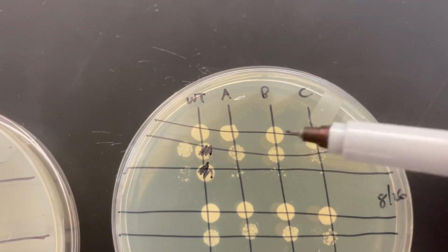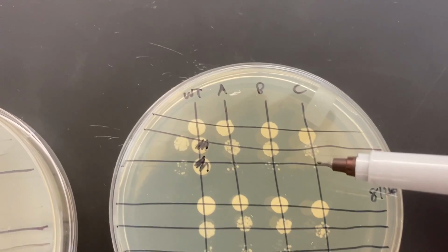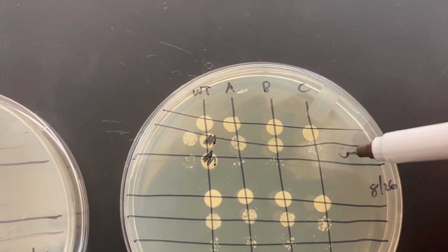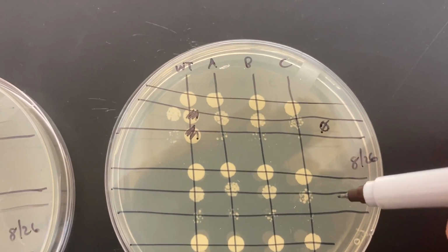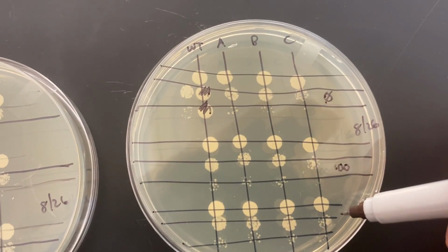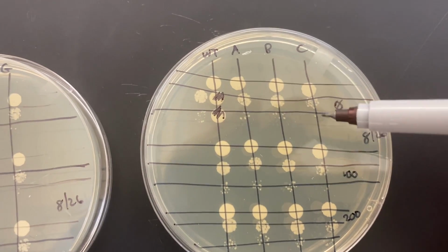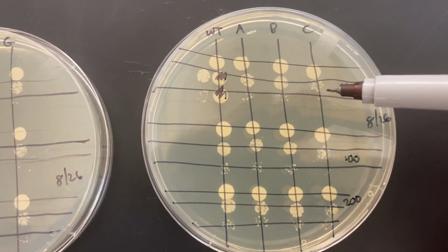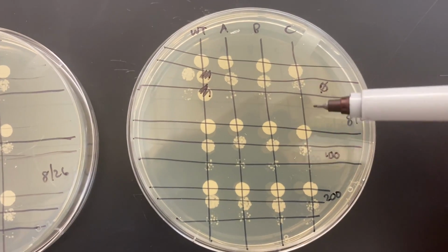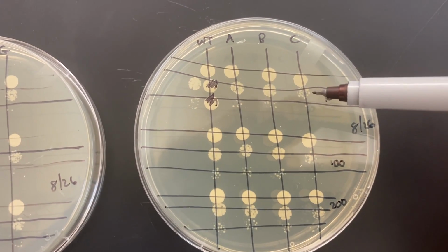And now we want to compare. So if we've established that's the right dilution to compare, 1 to 10, we're going to compare up on the top. This is the ones that were no UV, the middle was 100 microjoules per square centimeter, and the bottom was 200. And so we would notice if there was a DNA repair deficiency, the cells that were exposed to the UV light would maybe drop off in density compared to the ones that were not exposed.